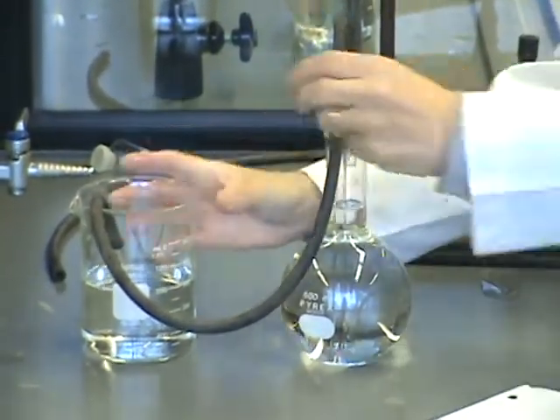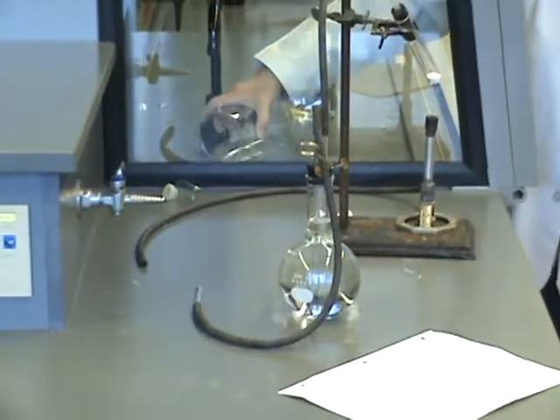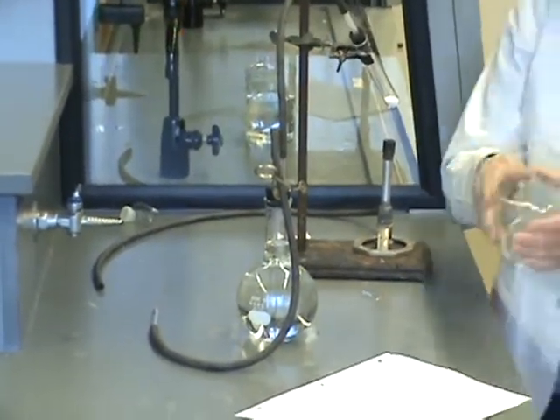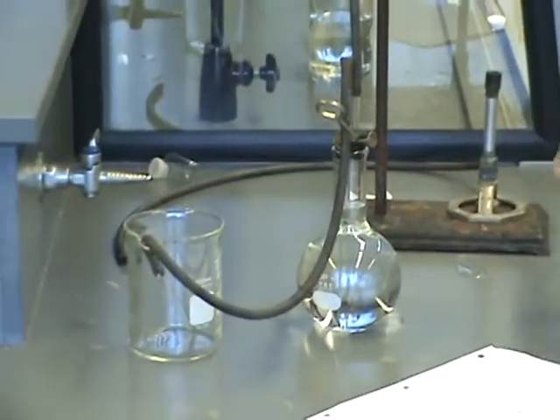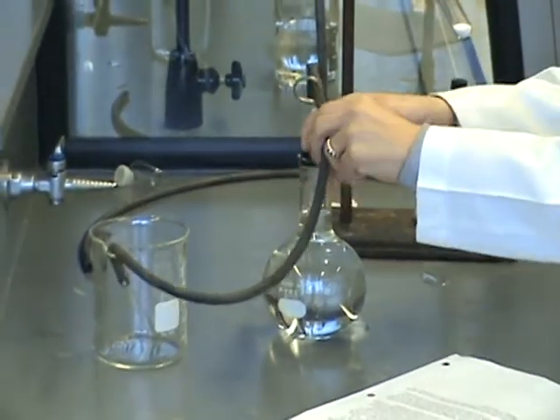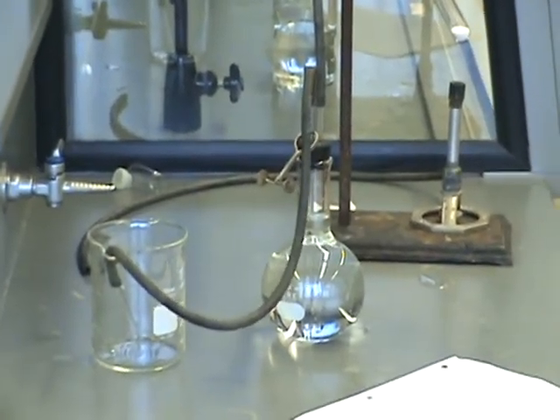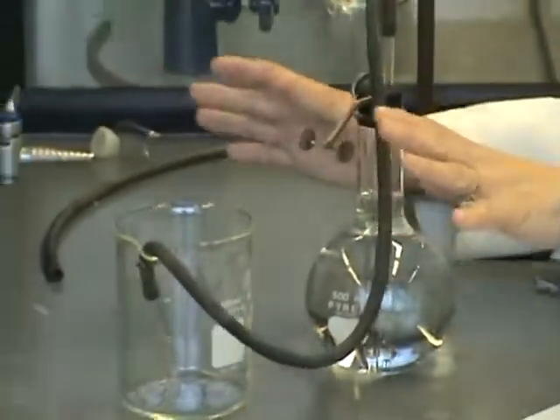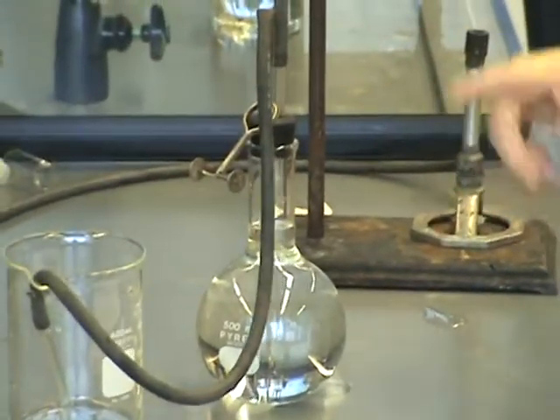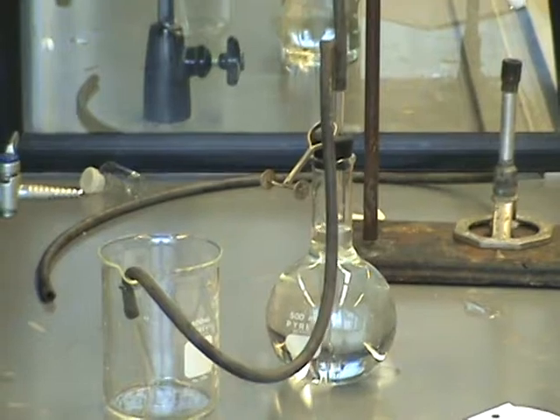On to step eight. It says, empty the water out of the beaker. Just pour it down the sink. Put your glass tubing right back in there. It says open the clamp. I'm going to open that clamp and just hang it out of the way again. So I'm opening the clamp. Just put it away and put it to the side. And it says only a few drops of water should flow, if any. So if I look at my beaker, I have just a couple, a few milliliters of water in there is okay, and then it quit. That's fine. That's the way we want it. If your water keeps flowing at this point, something's not set up right. The pressures are not equalized or there's a leak or something.